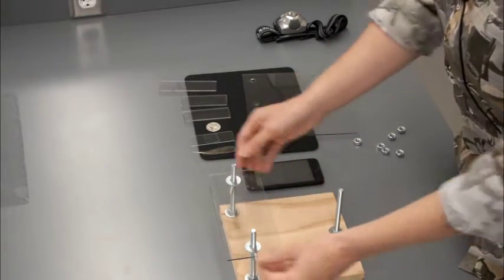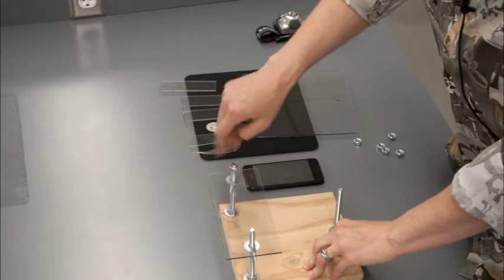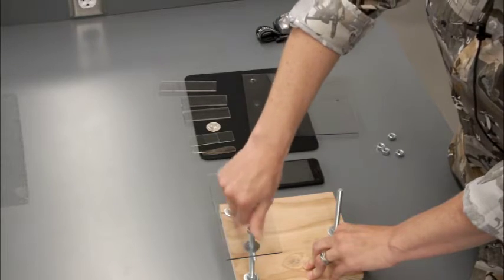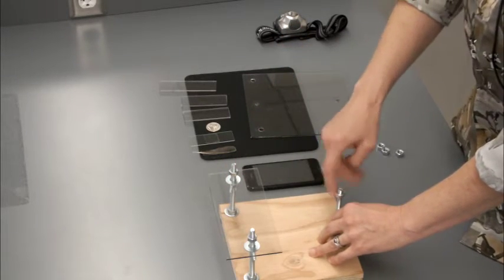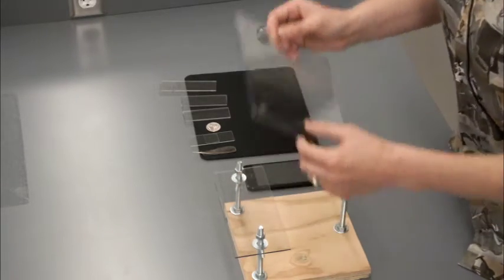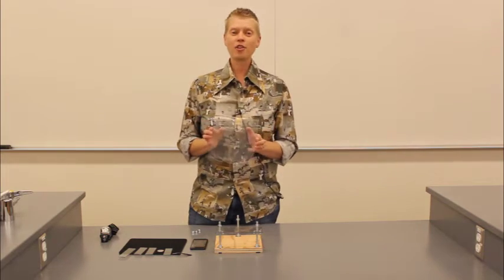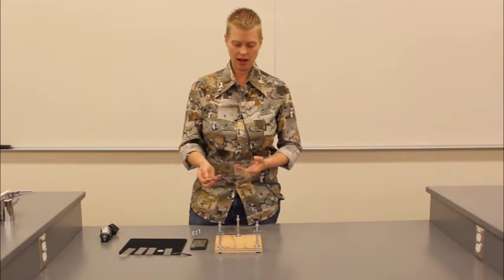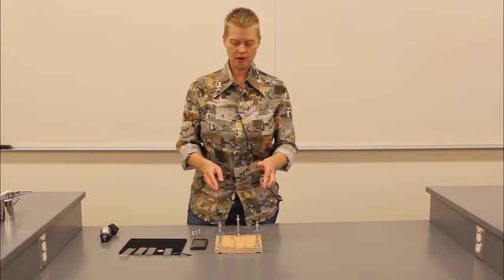Once you get the specimen stand on there, you're going to put 2 of your nuts on all of the bolts, all 3 of them. Oh, one more thing, forgot to tell you the most important thing. For your larger piece of plexiglass, you're going to need to drill 3 holes in it, 1 for each one of the carriage bolts that you have on your microscope stand.